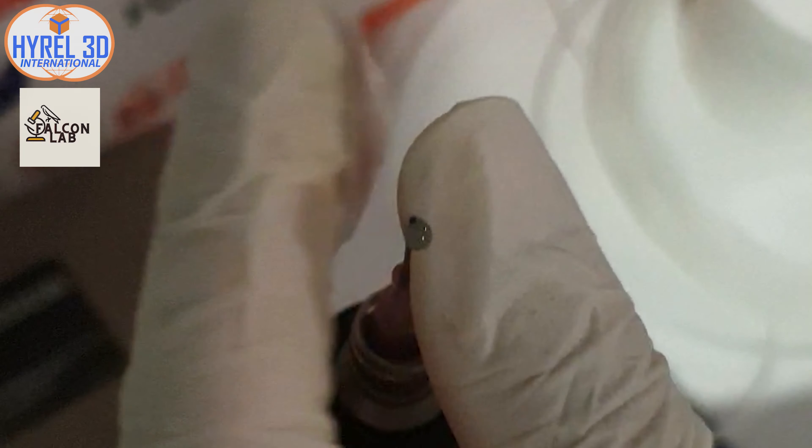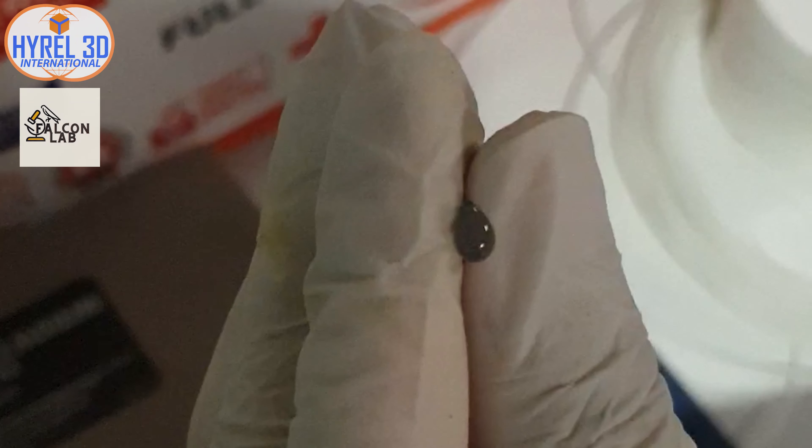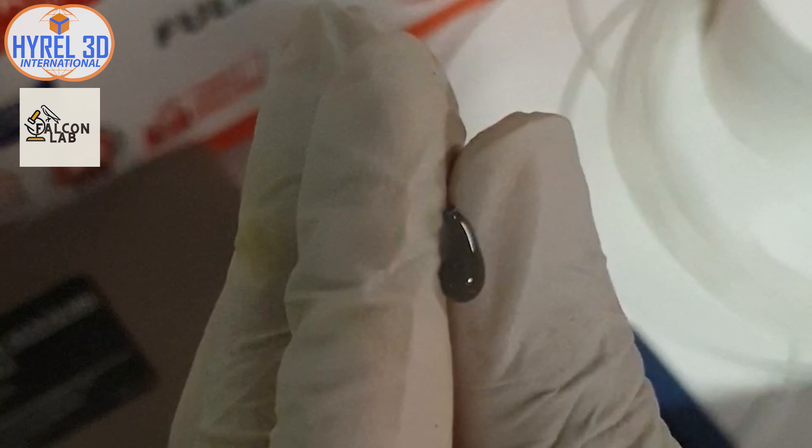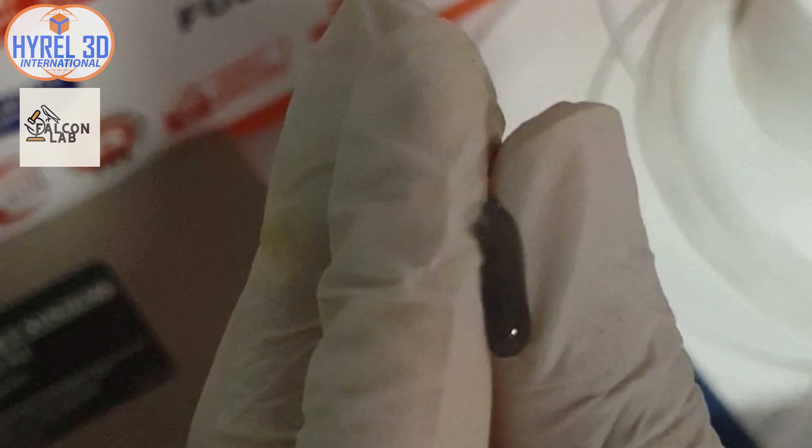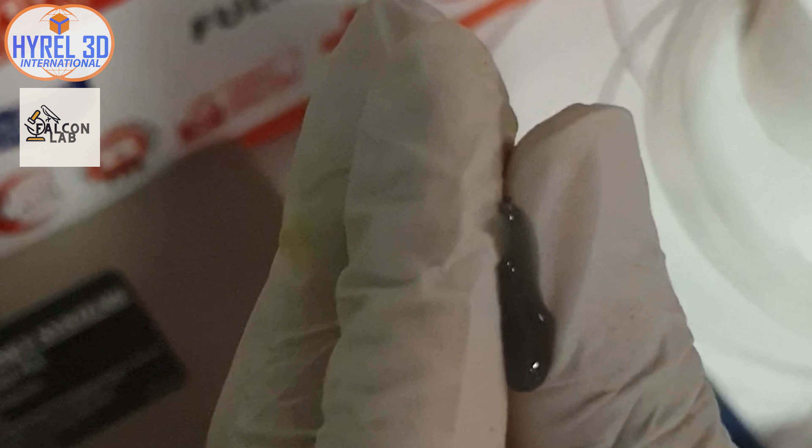After making sure it's tightly closed, we will slowly squeeze the mixture out to allow the foam and air bubbles to escape. There is no real measure of this process as the amount of bubbles varies each time, but pushing it out or at least making sure it collects on the surface is very important for a smooth printing process.